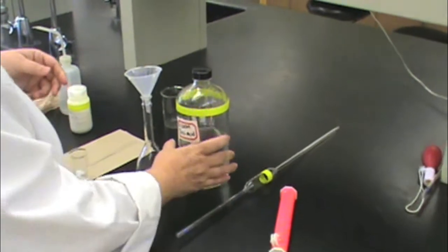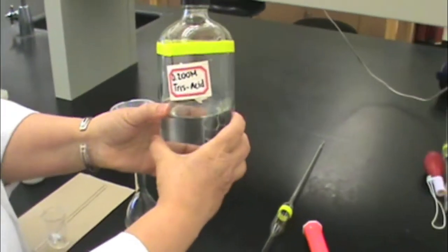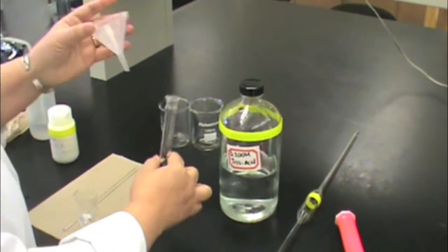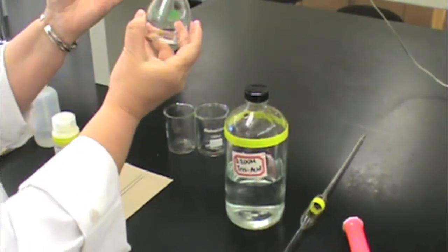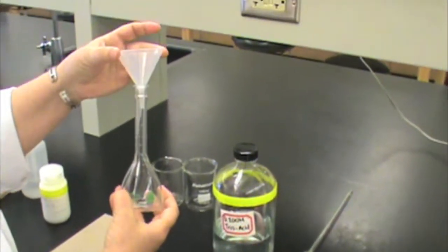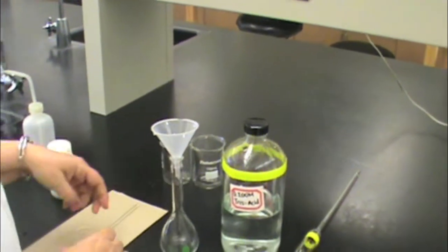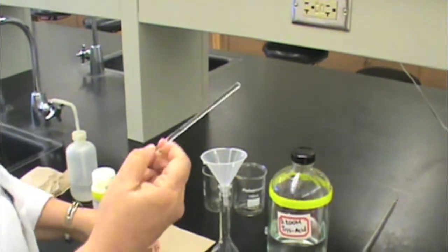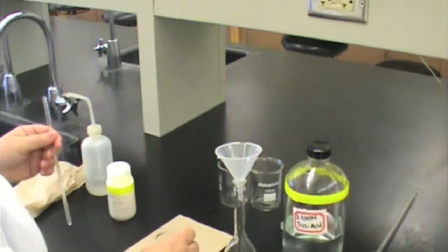a solution of your Tris acid, a 100ml volumetric flask, a funnel, a beaker containing your solid that you've already weighed out, and a glass stir rod.